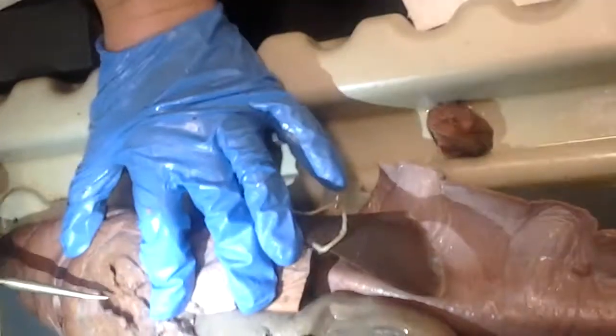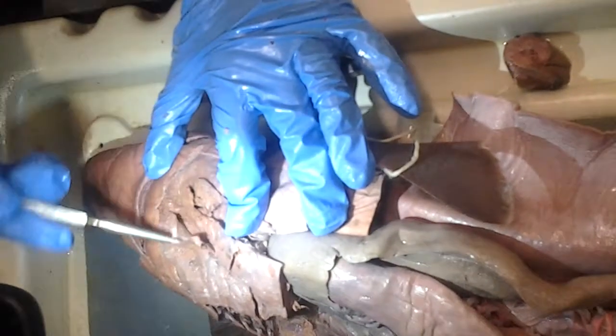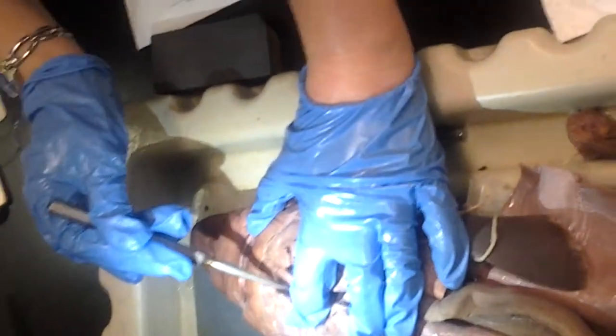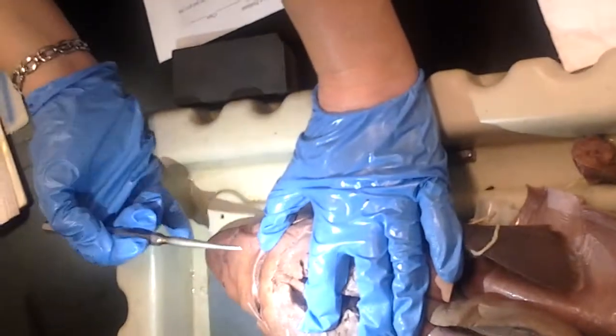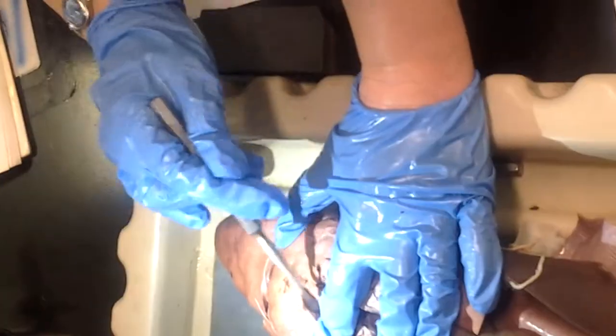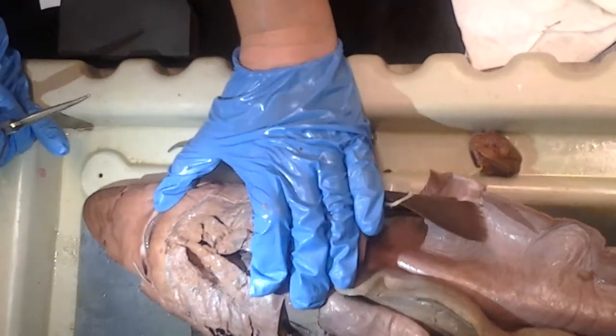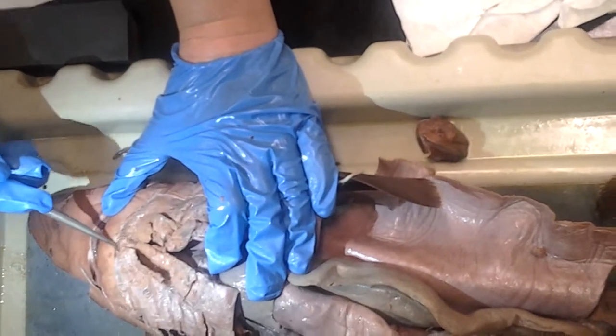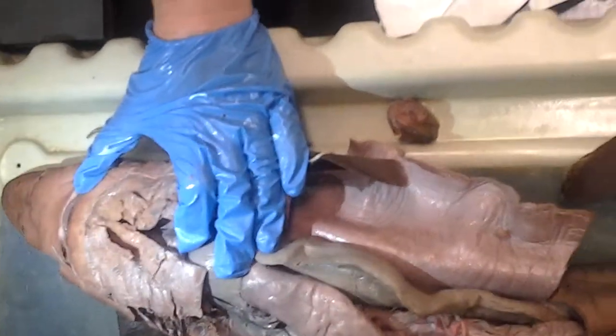We need somebody with a better chart for this. Yeah, that's the one we saw in the first. Common coracoarcualis to Meckel's cartilage. Then on either side, you have the two coracohyoids. Here's one and here's the other one. So this would be the right, this would be the left. Okay, so coracomandibularis here, coracohyoids. Coracohyoids go from the common coracoarcualis to the basihyoid cartilage. Right? So the basihyoid cartilage is that median cartilage of the hyoid arch.